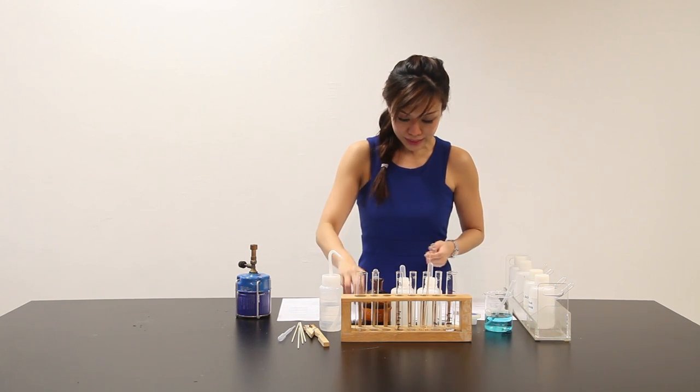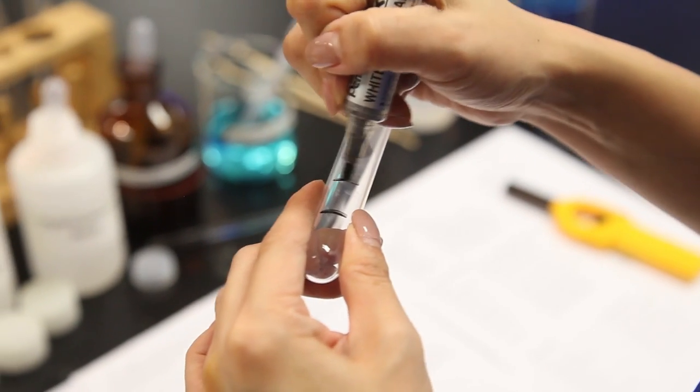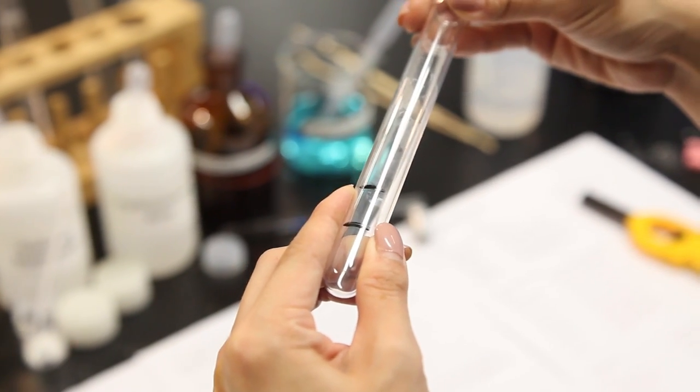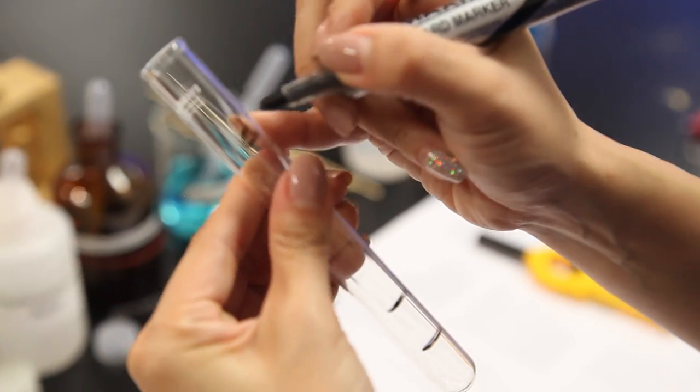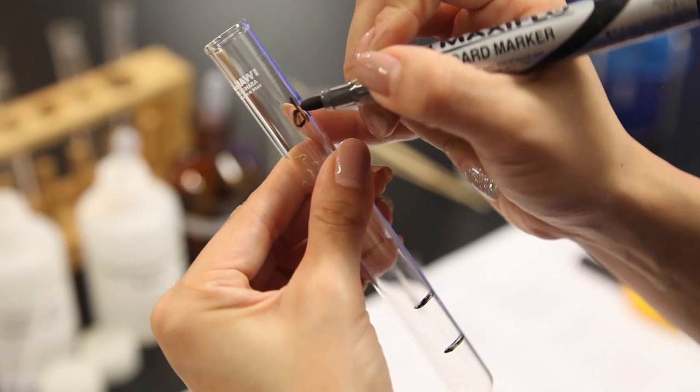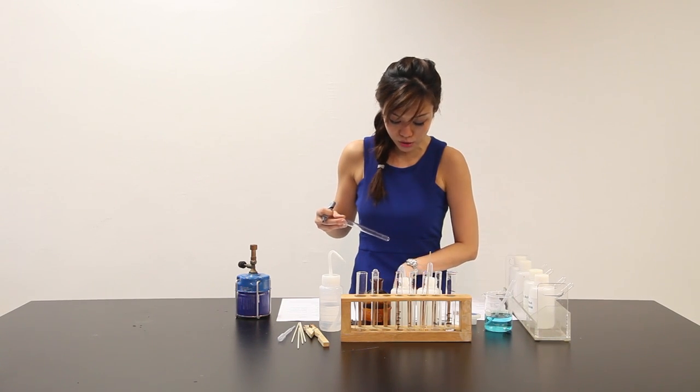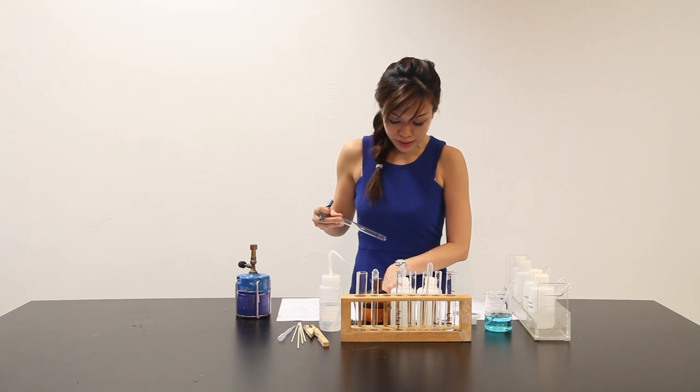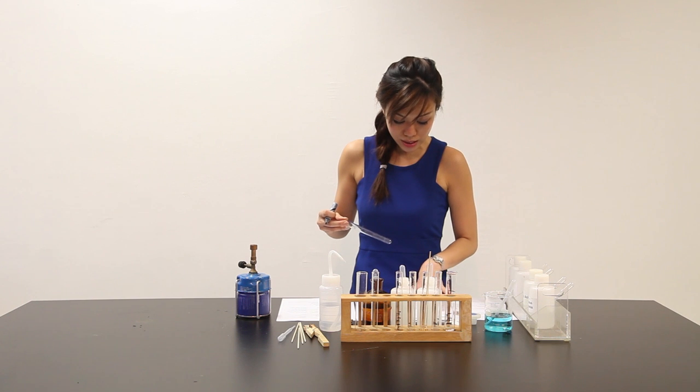D part 2. D part 2 says, let me label it, to about 2 cm³ of Y. Add another 2 cm³ of copper sulfate solution. Shake the test tube thoroughly. Then transfer the mixture into a boiling tube. Heat this boiling tube carefully until the mixture begins to boil. Continue gently heating the boiling mixture until no further changes is seen.